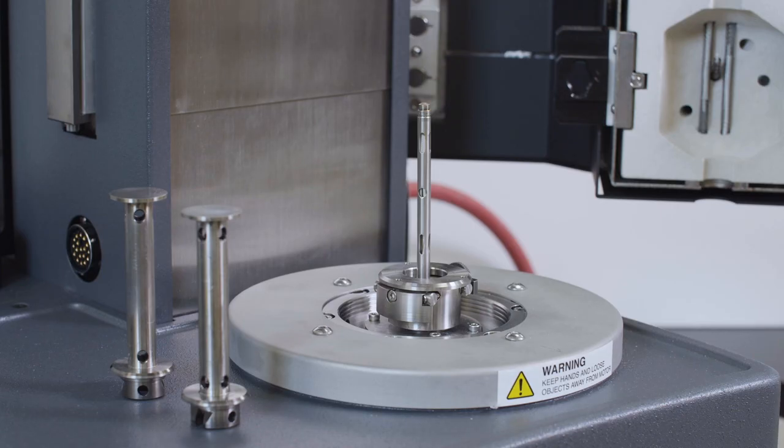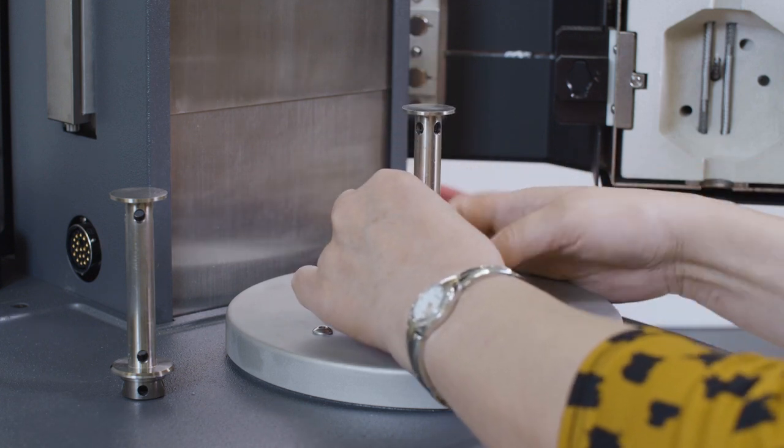Attach the upper and lower 25 mm plate geometry to the ARES G2 rheometer.